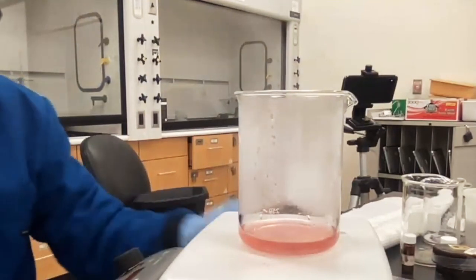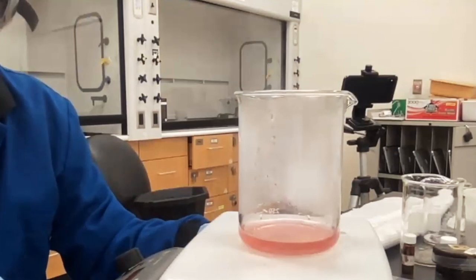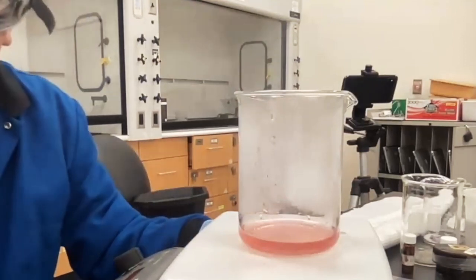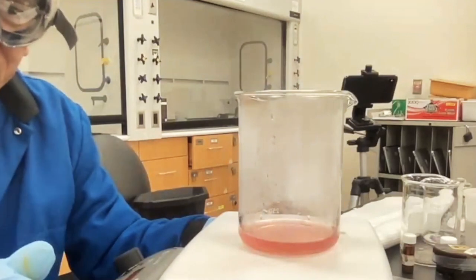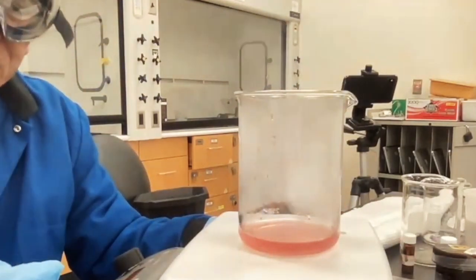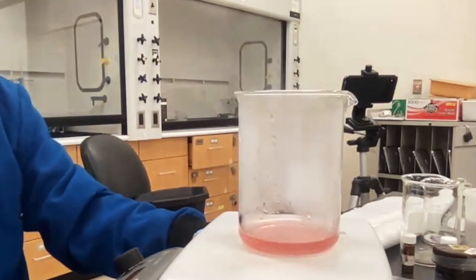And then what will happen is that when you get to about maybe 0.5 milliliters, half a milliliter, it really starts to form the solid. And the important thing is watch the color transformation as the residue of C, the chemical C, starts to go from the aqueous phase to its solid phase, to its dry phase. Okay, so that's what we're doing here.